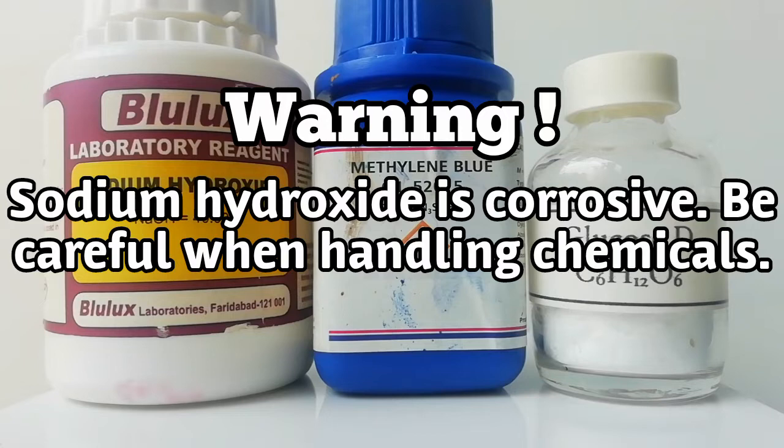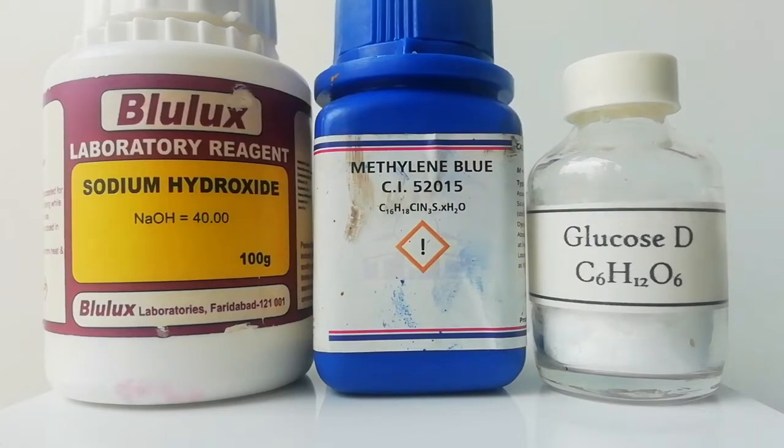Sodium hydroxide is corrosive, be careful when handling it. Today I am going to show you how to do the popular blue bottle reaction.